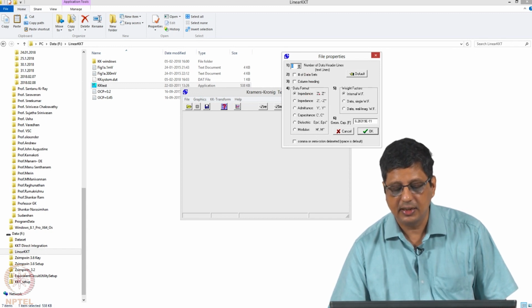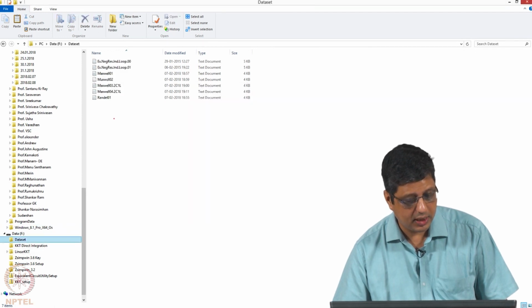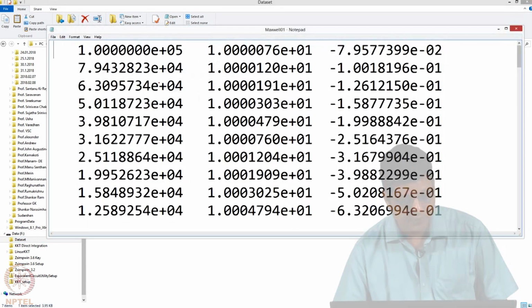Impedance, it is given as Z real and Z imaginary, given as Z prime and Z double prime. Space delimited data set, so I am going to look at the data set which looks like this. Space delimited, frequencies, real and imaginary part.